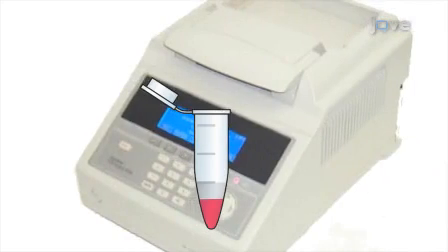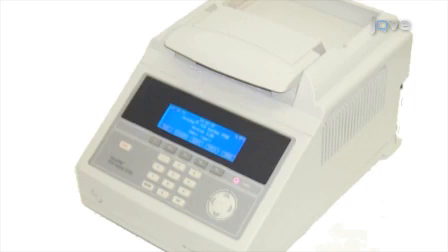The third step of the procedure is the temperature cycling, under conditions carefully optimized to give the greatest sensitivity and eliminate nonspecific amplification.